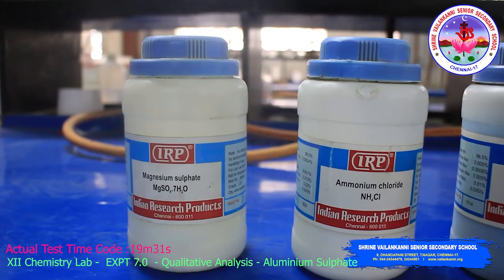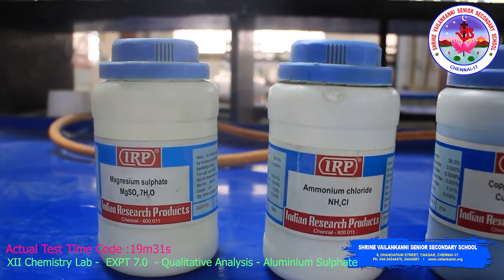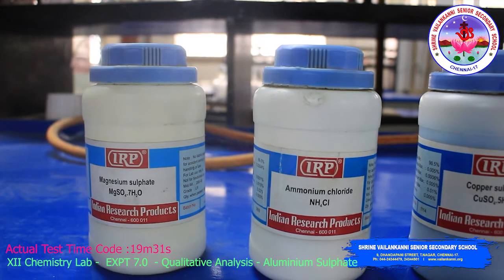Students, we will perform these salts. Usually in the examination we don't tell what salt is given; you have to identify it with the help of the systematic procedure.